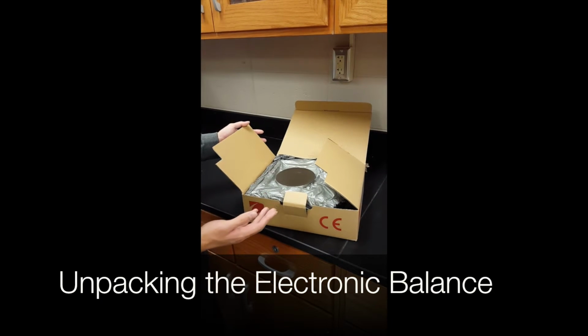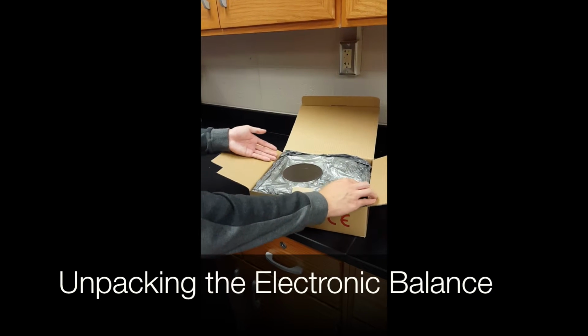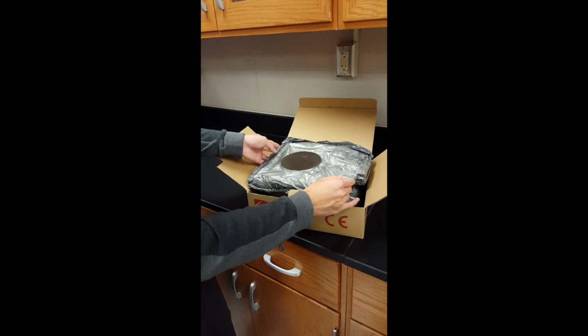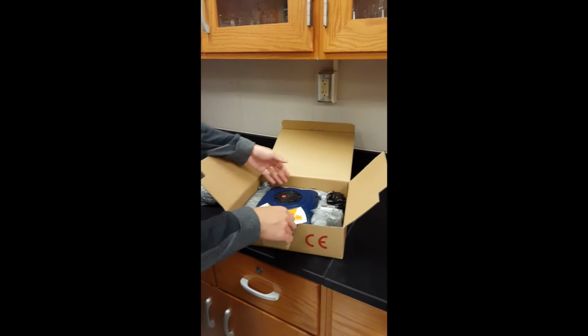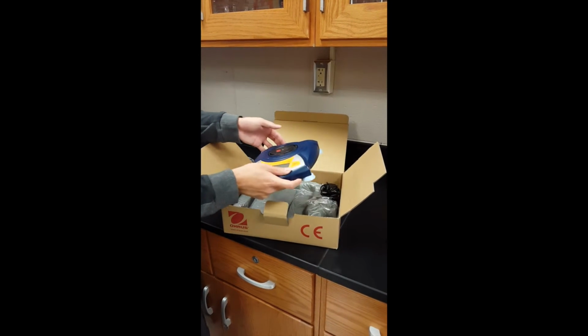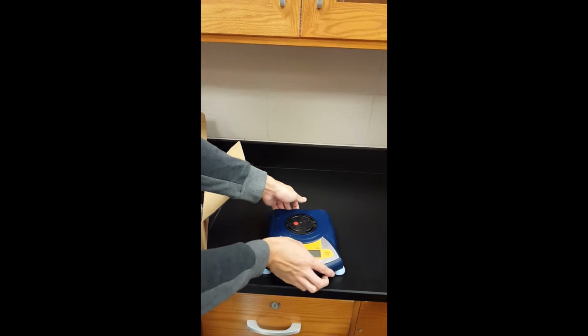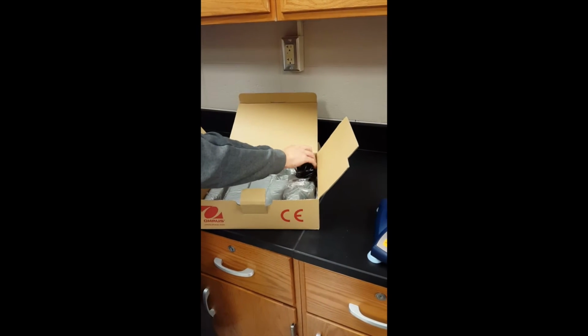Now when you first get your balance, it'll probably be packaged in a box like this one. When you open it up, you'll see a metal weight plate on top of some styrofoam. Carefully remove the whole thing and place it aside. Underneath you'll find the actual balance as well as the power supply. Carefully remove the balance and place it on the table. Alright, right there. You can just take out the power supply and put it aside for now. We'll put it in later.